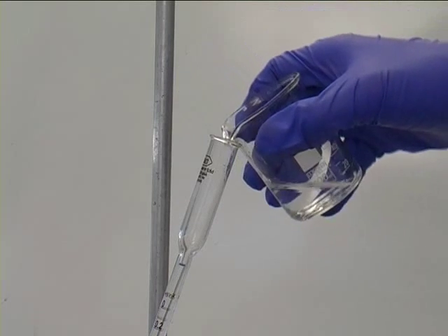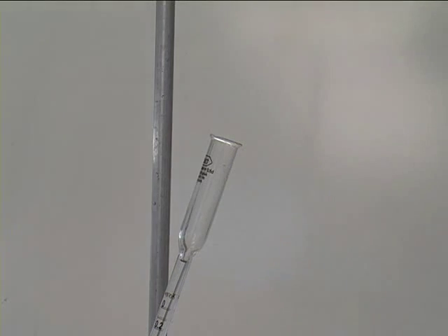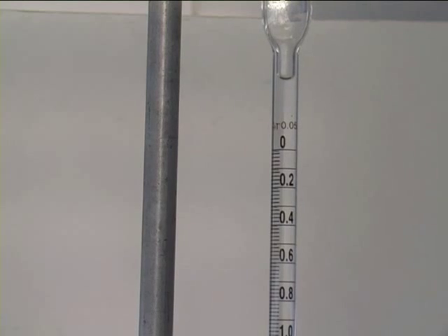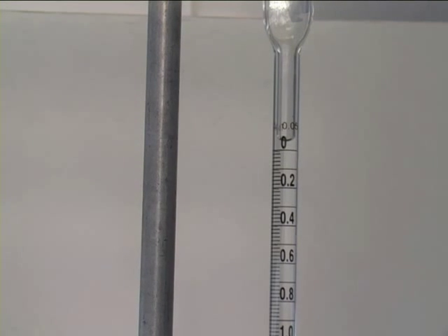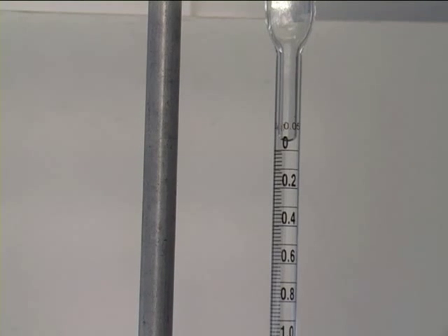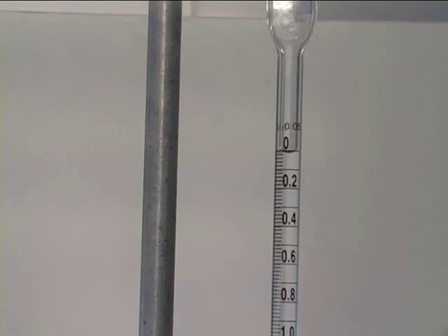Be careful not to overfill the burette. Run the liquid level down until it is at a measurable value. You measure the value from the bottom of the meniscus.